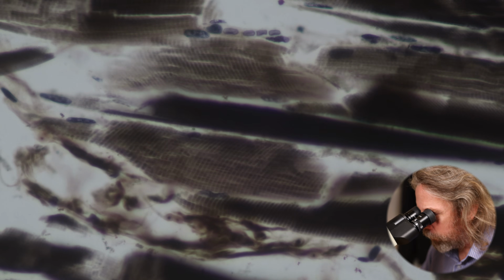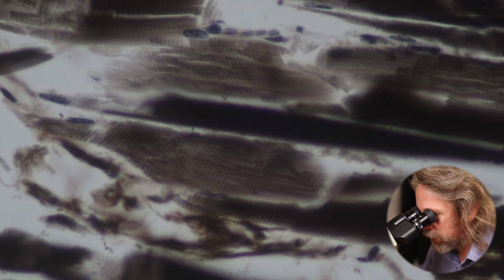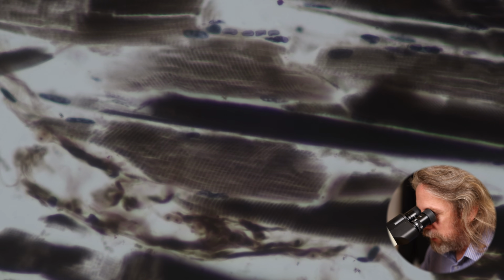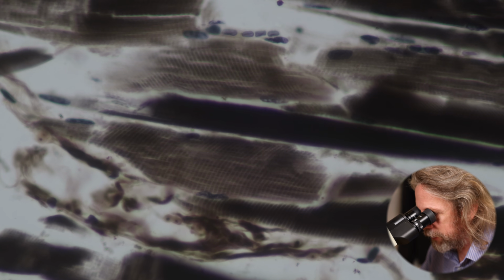So I assume this is just from a skeletal muscle somewhere, not from the tongue. This is just from a bog standard skeletal muscle somewhere in the body, and we can see those striations now. This is why we call this skeletal muscle striated muscle. And if we look at the muscle in the heart, which we will do in a future week, we'll see that it's also striated. It looks similar.